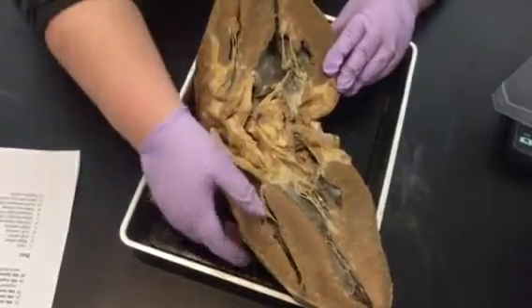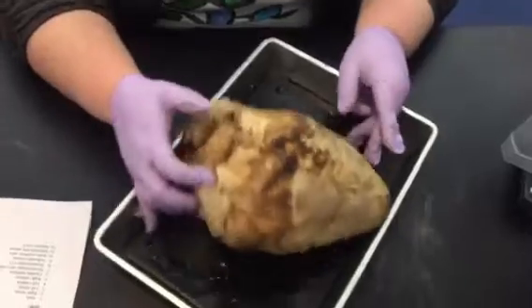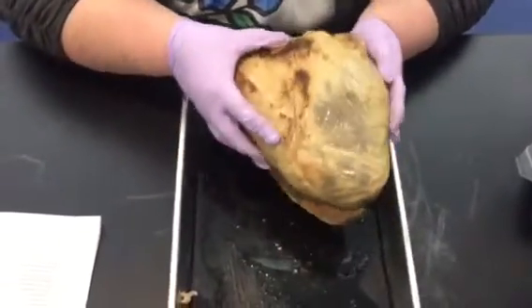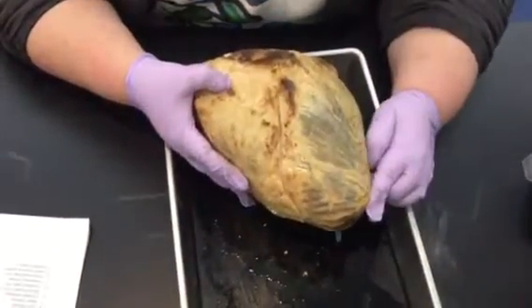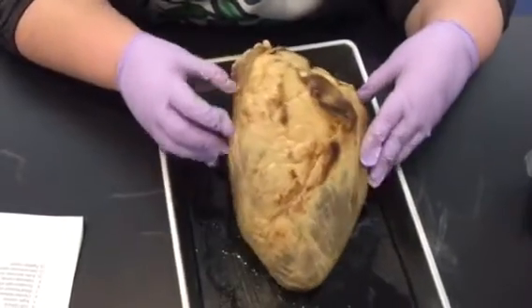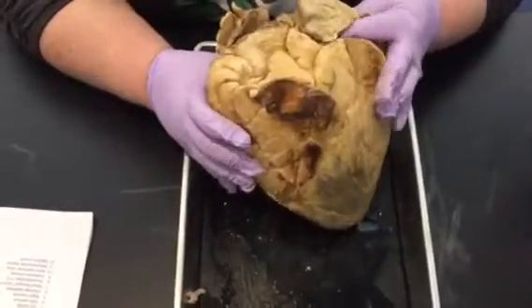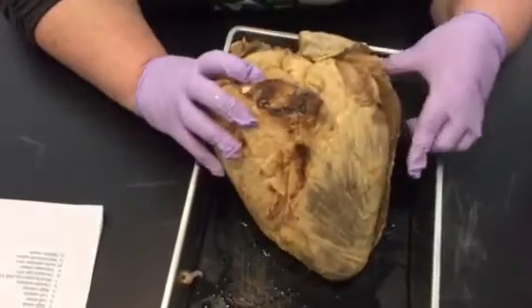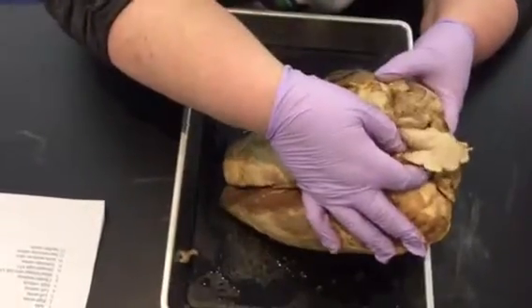Let me work through all the parts, starting from the top. From the front of the heart you can see a few things: you can see the apex of the heart — the very tip. On the outside you can see these little auricles, the little floppy-looking things on the front. This is the left auricle, on the same side as the short side. And the right auricle.